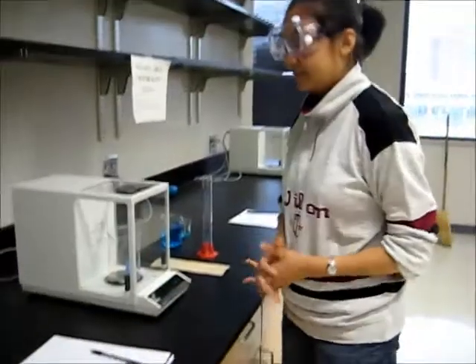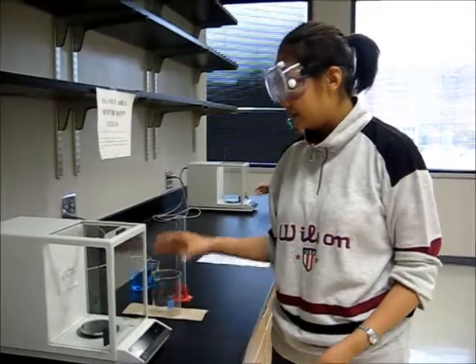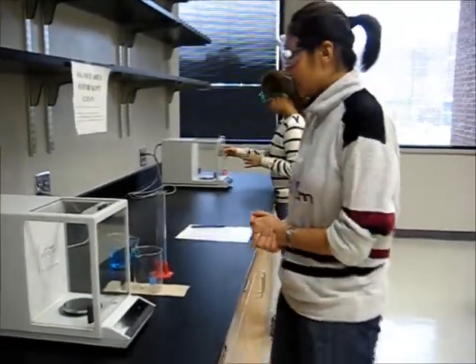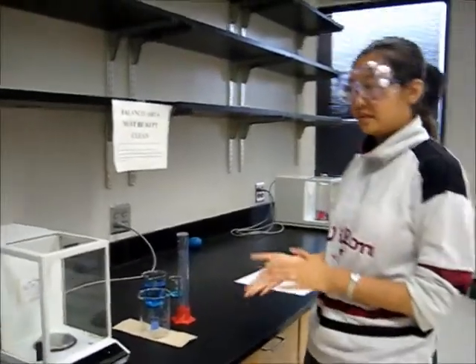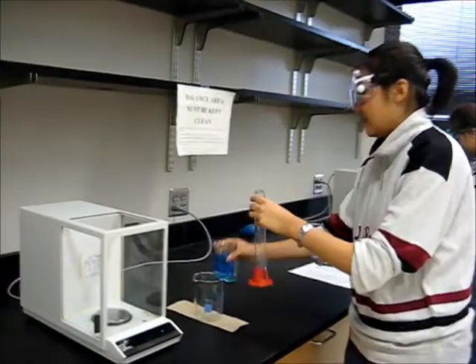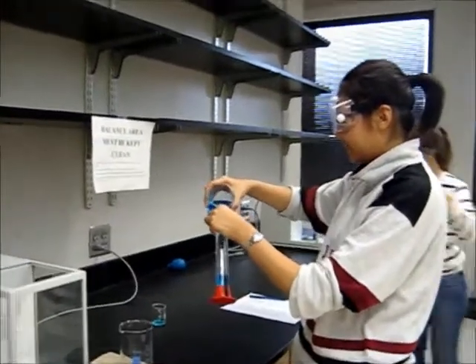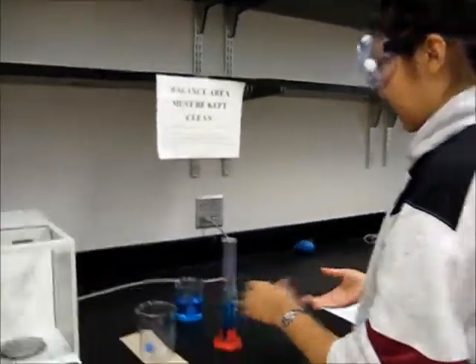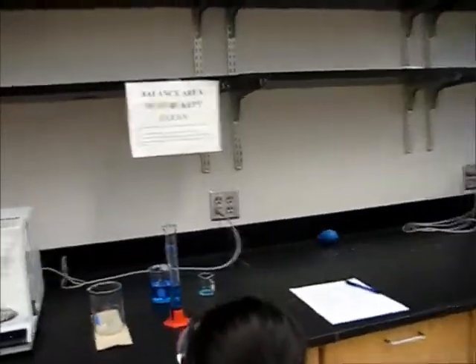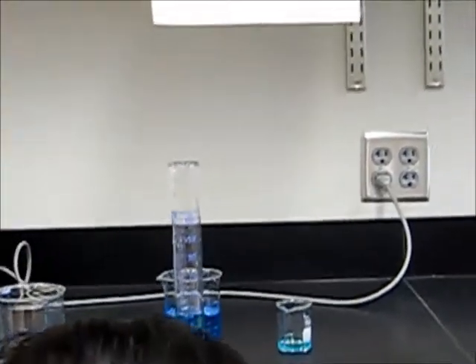And then we open the door and get the empty beaker out and close the door. And first we should get the volume of the liquid we are going to transfer. So we can pour some of the liquid into the cylinder and put the cylinder on a balanced table, and then dip down and make sure the meniscus is equal to the eye level, and then read the volume out.